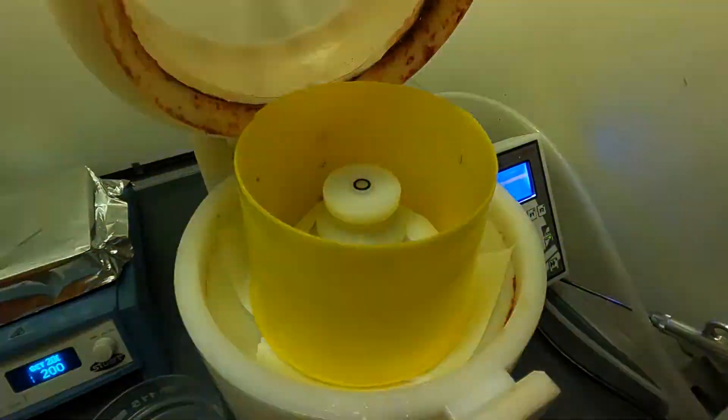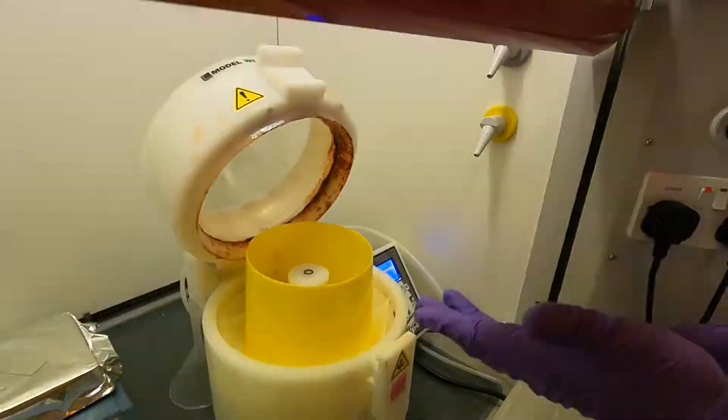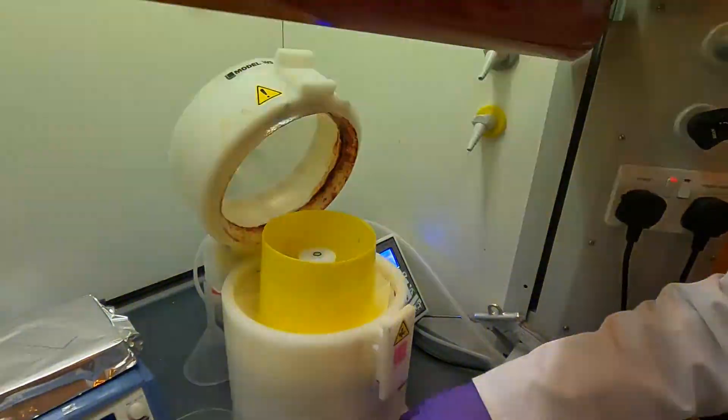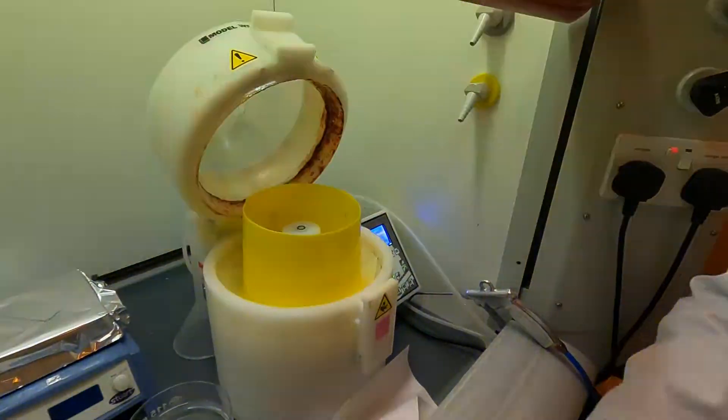The splash guard is a sacrificial thing, so at some point it will be disposed of once it gets too full of SU8 and gets overall too sticky.